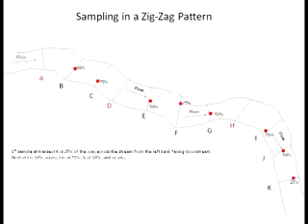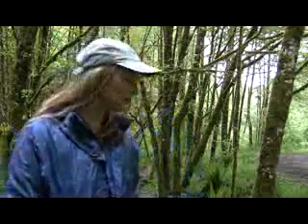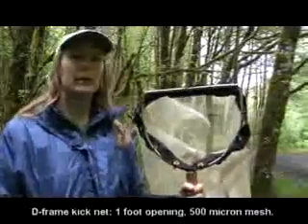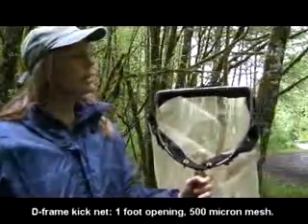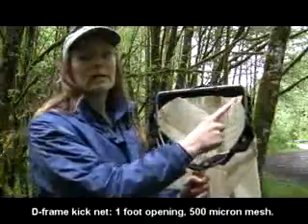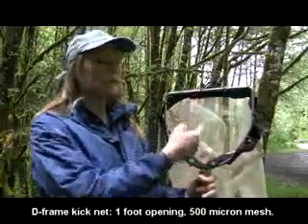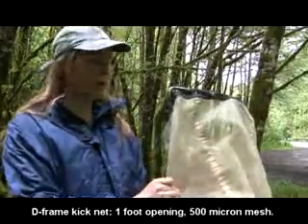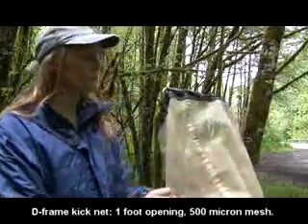It's pretty straightforward equipment also required for this process. There's very little equipment that you actually need. Our primary piece of equipment is the D-frame kick net. D-frame kick nets should be approximately 1 foot across at the bottom of the net and about 1 foot in diameter. In addition, you should have a 500 micron mesh attached to this kick net.